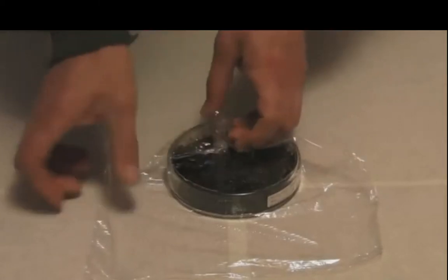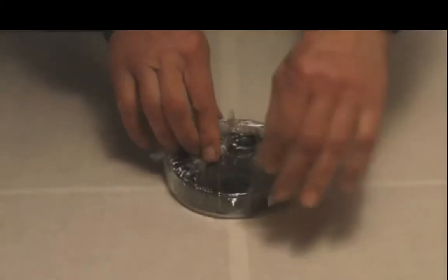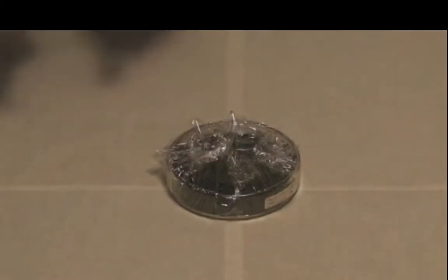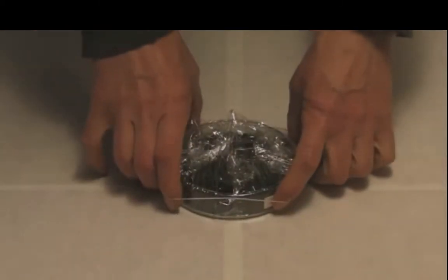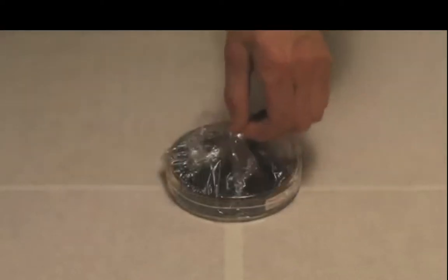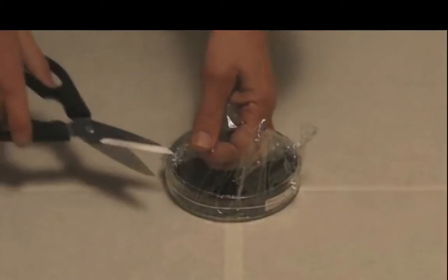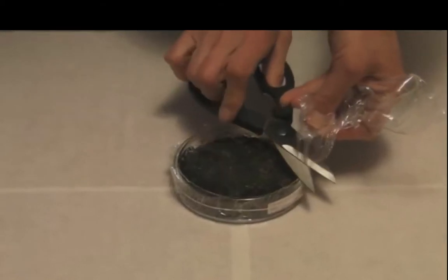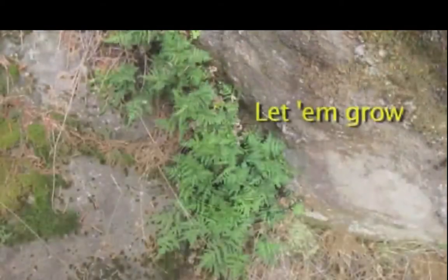After sowing, the Petri dish is wrapped with saran wrap. This holds in moisture and helps prevent air currents from introducing contaminants. This gives the gametophytes, the first stage of fern growth, a head start. The saran wrap will stay on for 1 to 3 months. It only comes off once the gametophytes have covered the surface of the Petri dish with a green layer. 1 to 3 months. Wow.